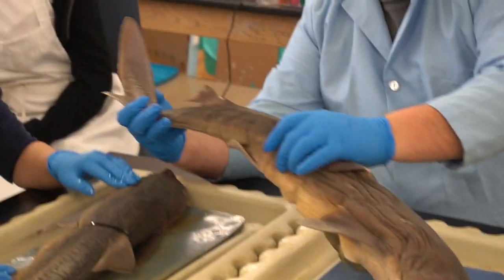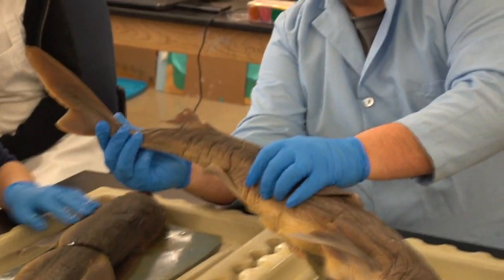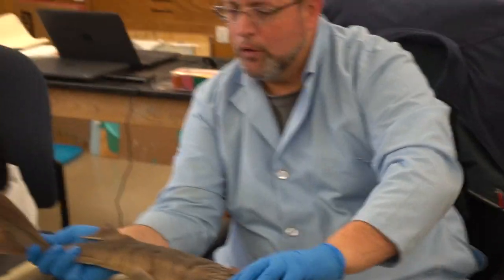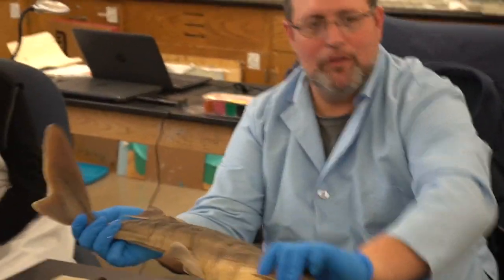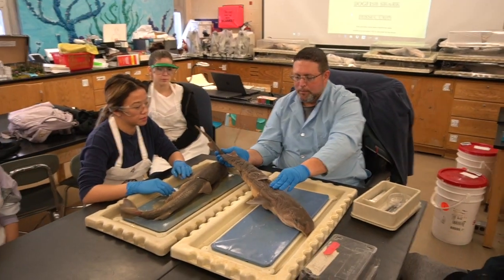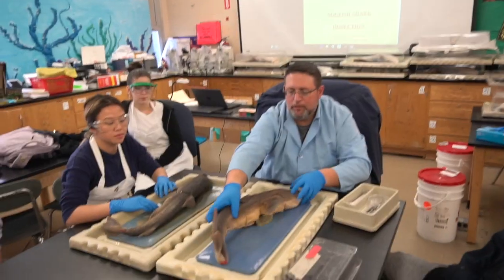The difference that we said yesterday about the caudal fin of this is what? One end is shorter rather than longer, and what was the job of this larger one? To stabilize the shark in the water. If that's not there, it would over-rotate, okay? So that's basically our external anatomy here. Any questions about that?